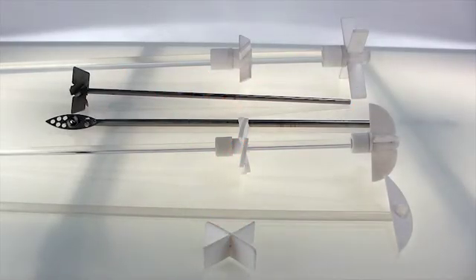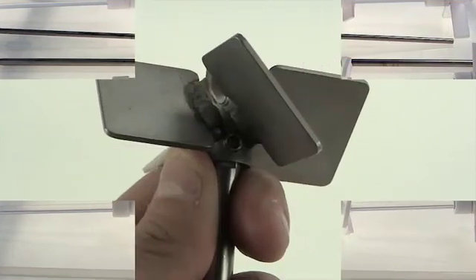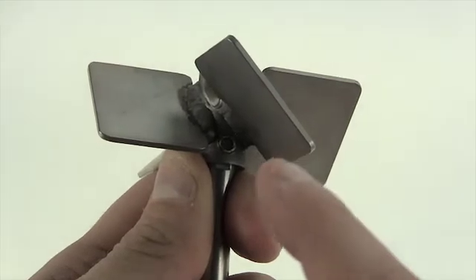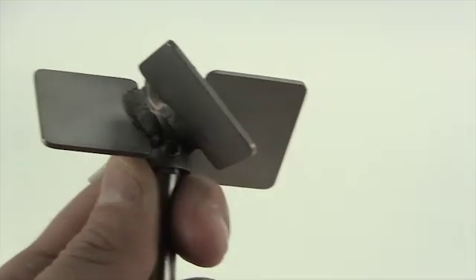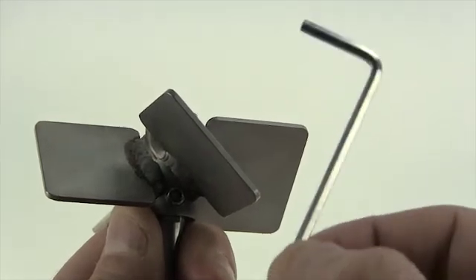First up are a stainless steel stir shaft and its vertical and pitched blade style agitator. Notice that the agitator uses a set screw to secure it. Make sure you have the correct allen wrench — this particular agitator needs a two millimeter allen wrench.